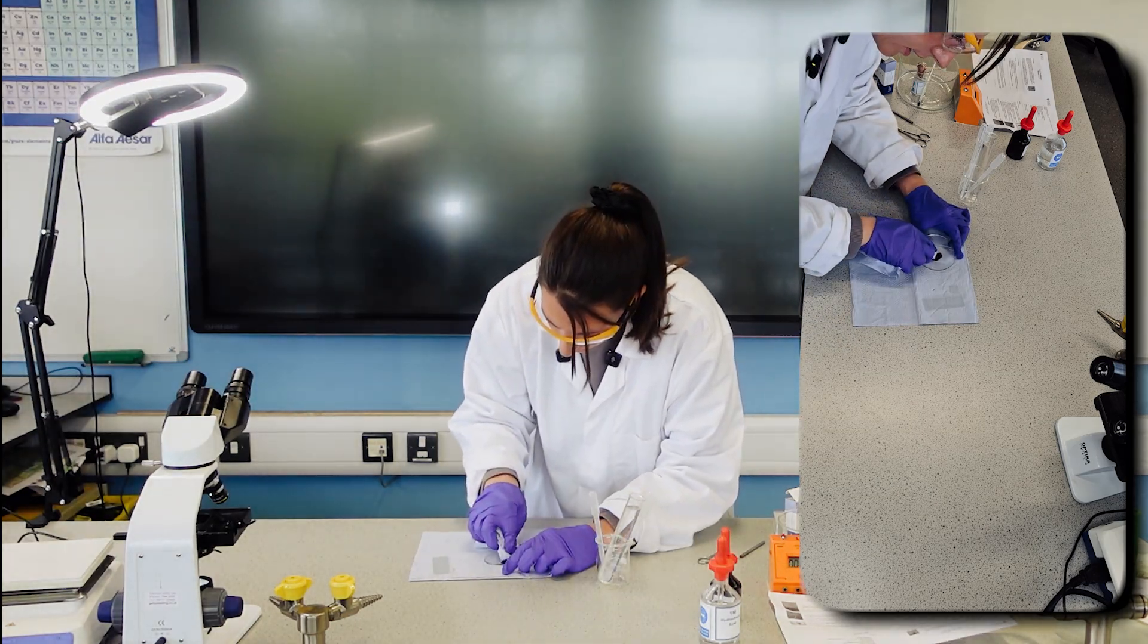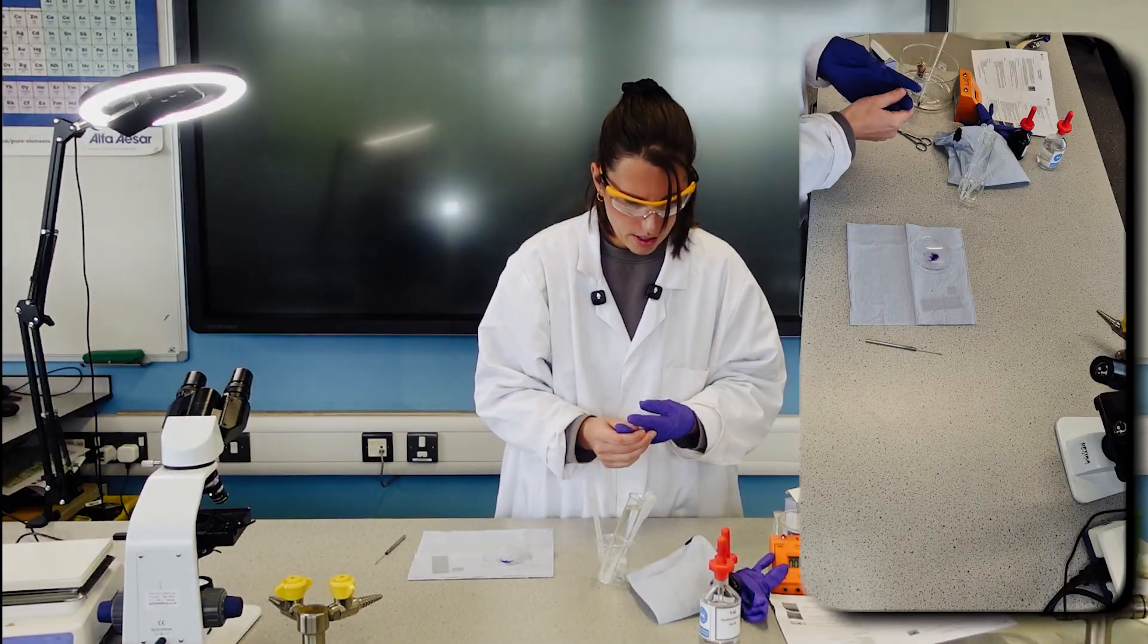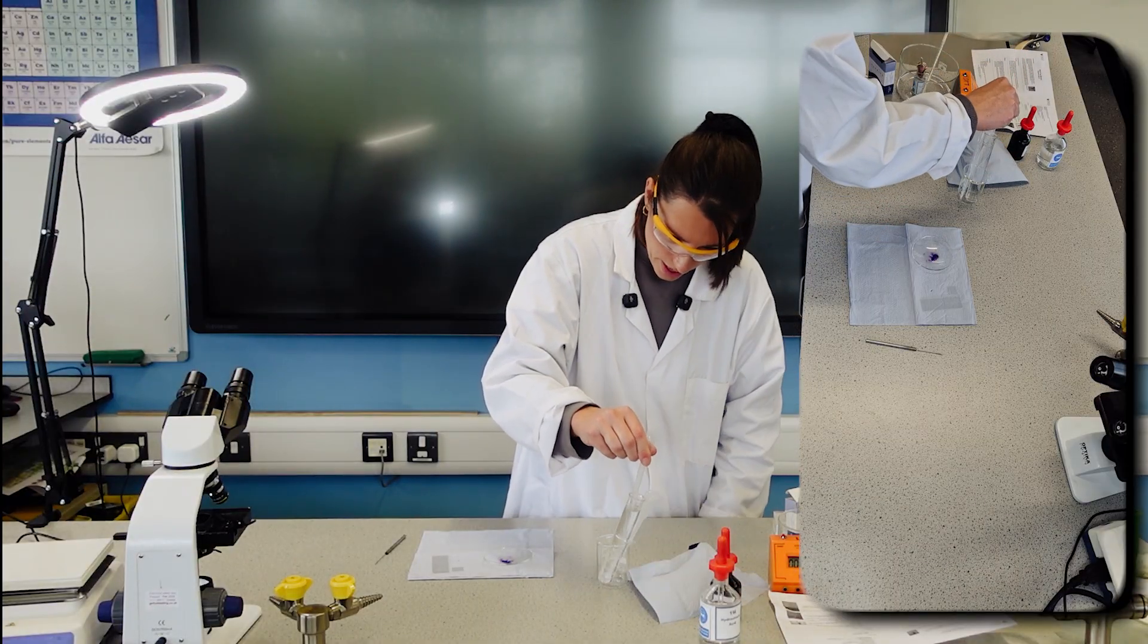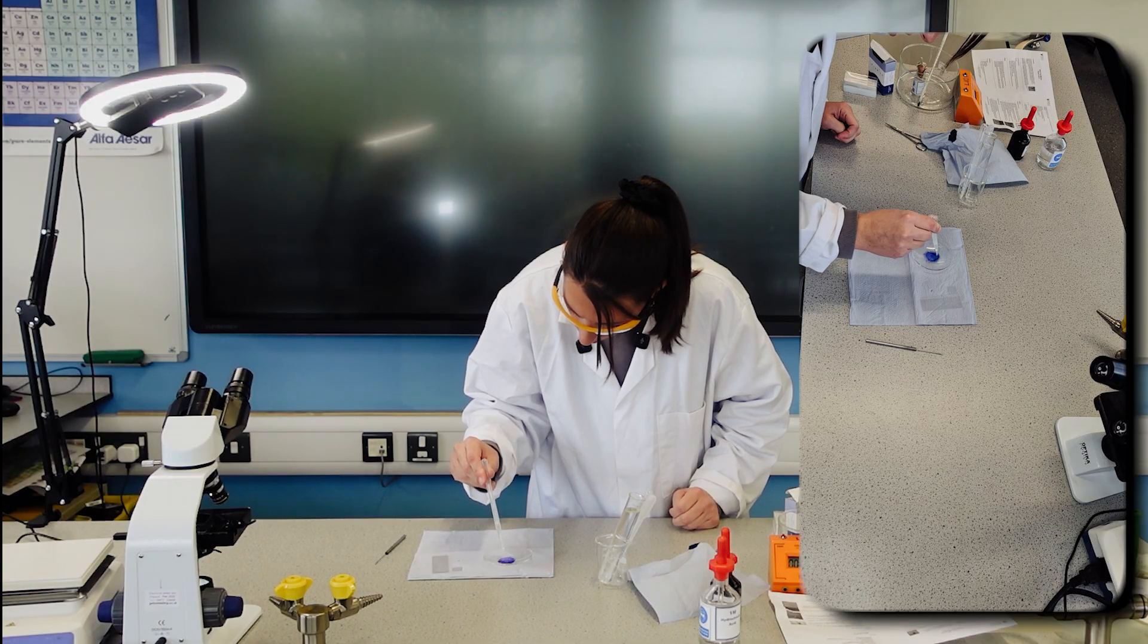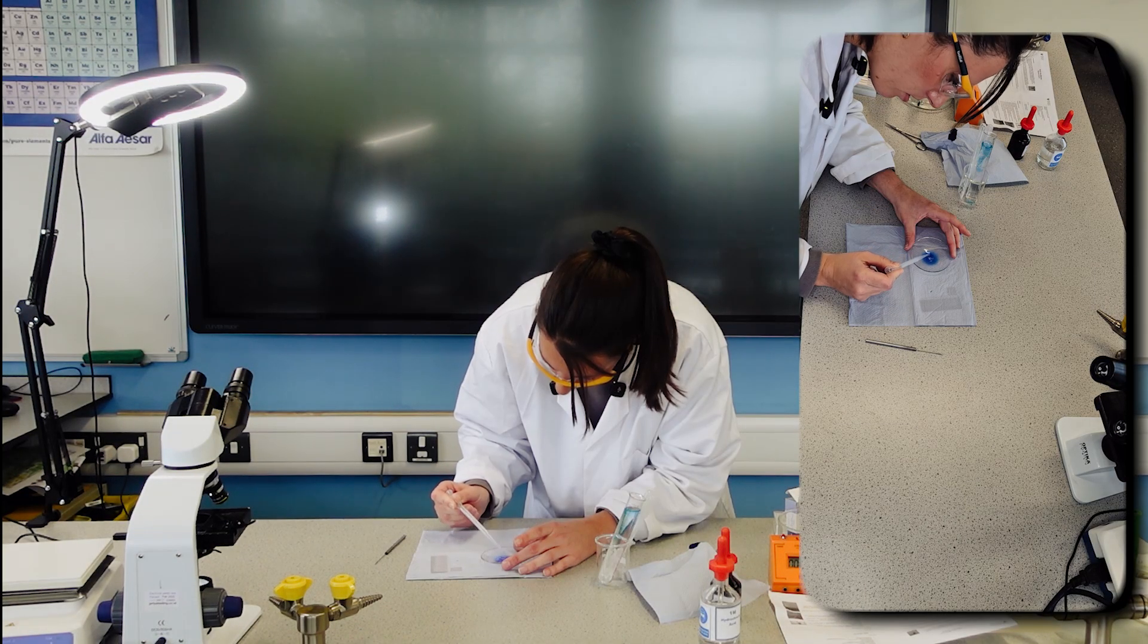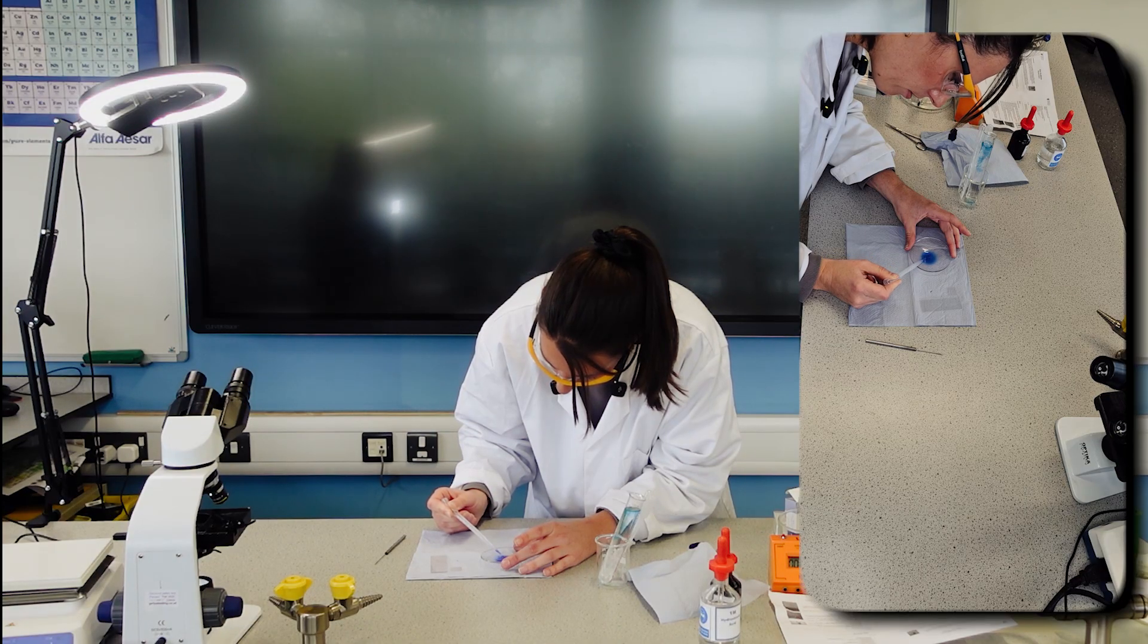I'm just going to remove some of the excess stain. Let's take these gloves off. Rinse it with some water just so I can see. I'm going to try and deliberately now just suck up my root tips and place them onto my slide.